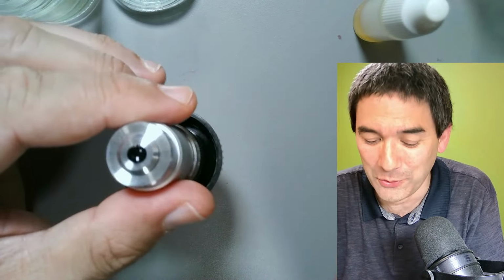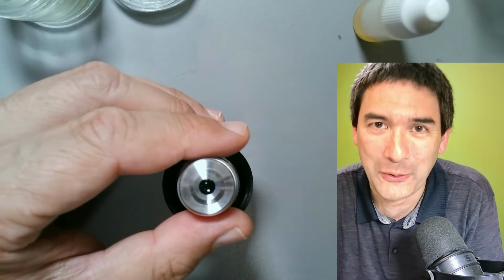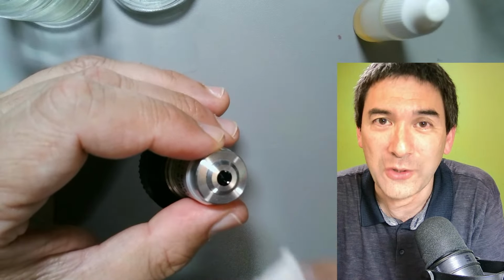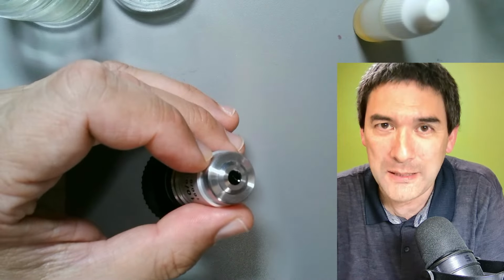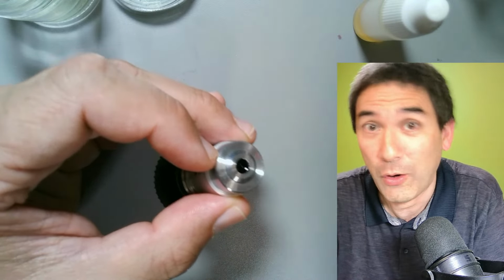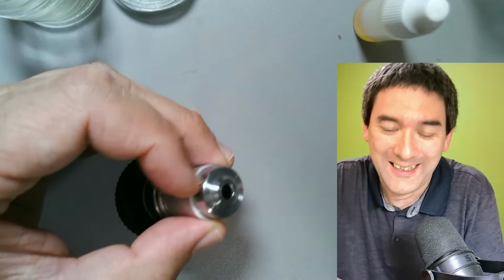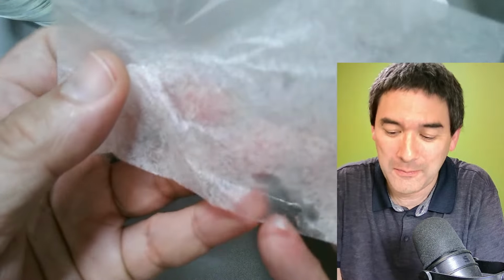He told me that those lenses are more stable, stronger, and able to withstand more than what you might think. The lenses can take more aggressive cleaning than what sometimes people are willing to do. So he said, don't be afraid. Don't use any hard objects, obviously, but if you do something like this, apparently it's not a problem. Don't be afraid to dig in and scrape out the dirt, so to say. I was told. I still didn't do that because I was too afraid, but this is basically how it looks.